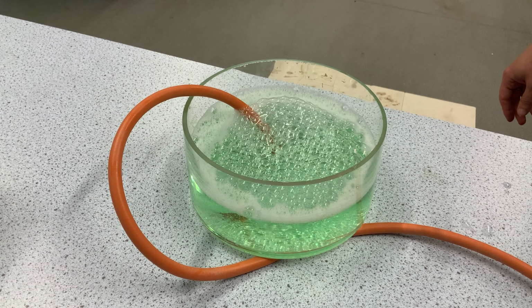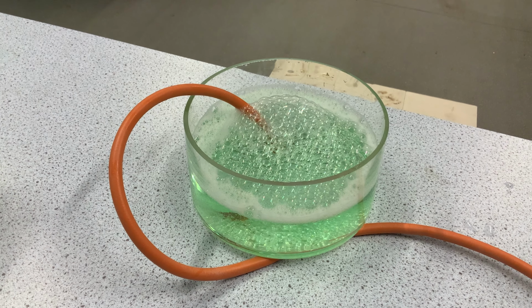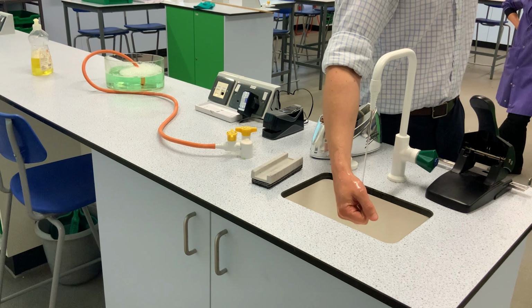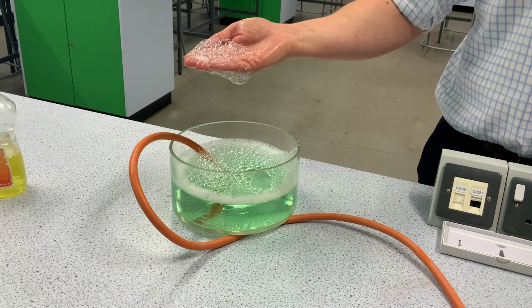While you're waiting for the methane bubbles to form, you can ignite a wooden stick. You need to keep it away from the bubbles at this point, which will be used later to combust the methane bubbles. Before scooping out the methane bubbles, you must dip your hand into the soapy water or cover it in water from a tap. This is a really crucial step to avoid any burns and injuries.